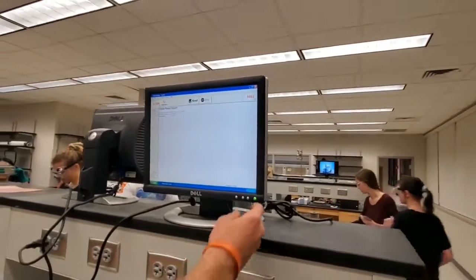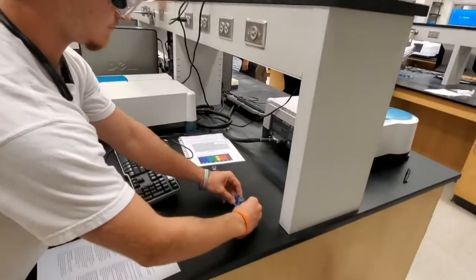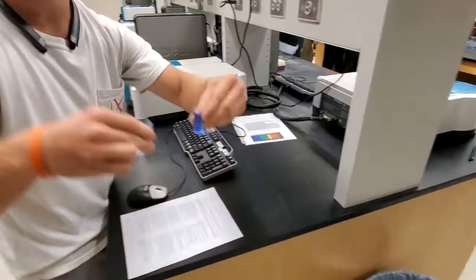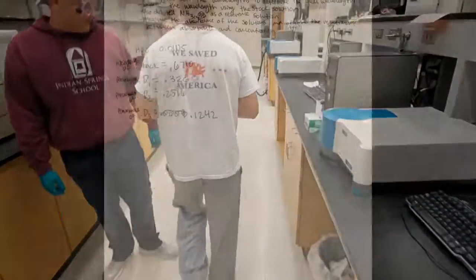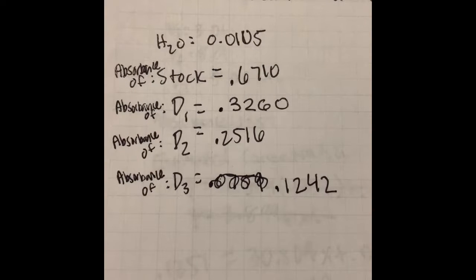When you are finished reading, you can close out the program. When you are done measuring and recording all of the absorbance values, do not forget to clean your area. Always record the data in your notebook using the correct number of significant figures.